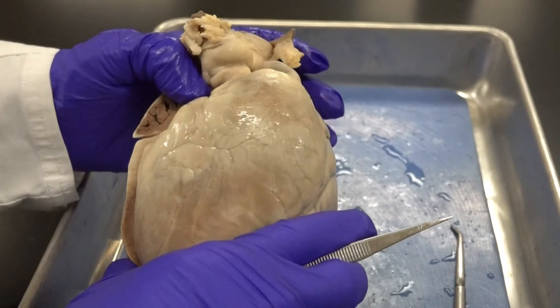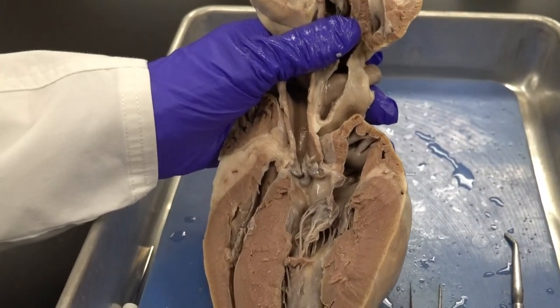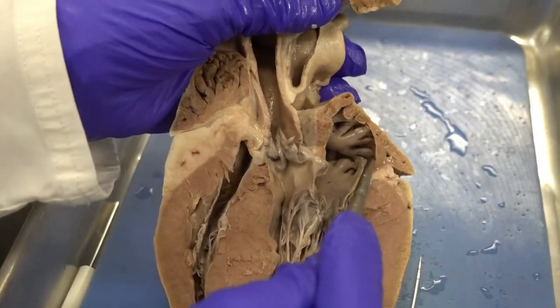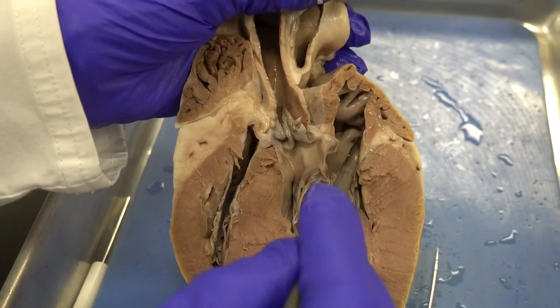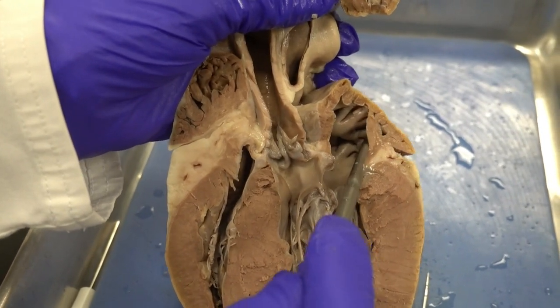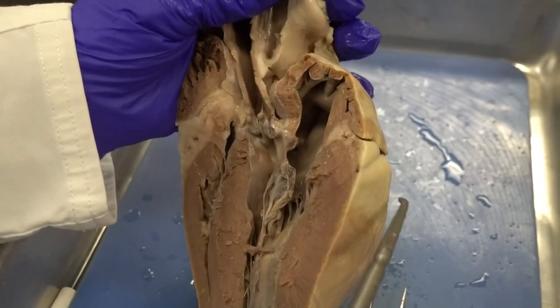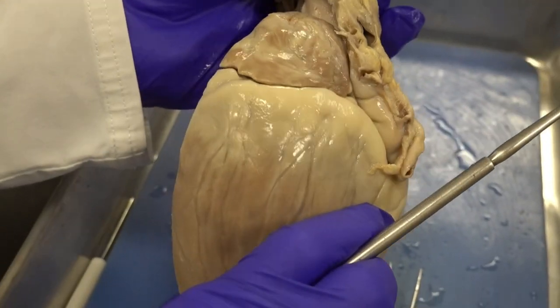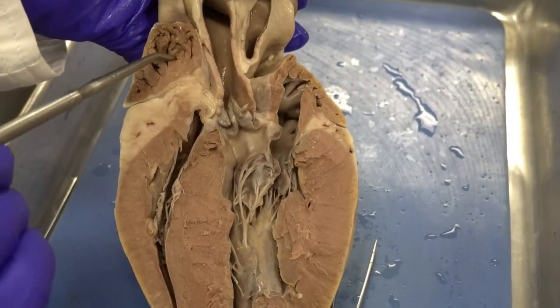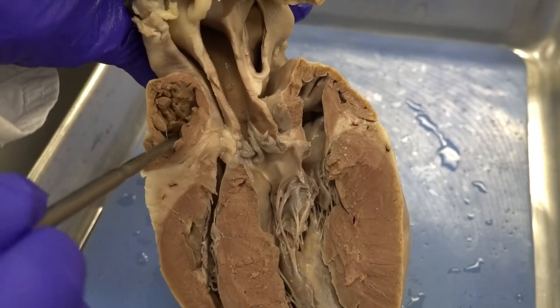For the left atrium, we have four pulmonary veins that bring oxygenated blood from the lungs into the left atrium. Here I can see the openings of the pulmonary veins — the ones I'm pointing at are the left pulmonary veins, and here are the openings of the right pulmonary veins. Unfortunately the pulmonary veins were cut very short, so we can only see their openings.